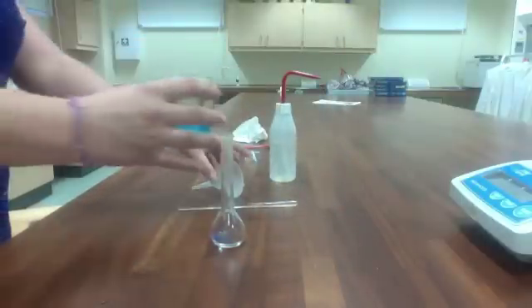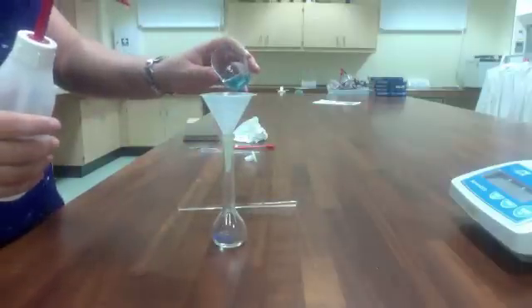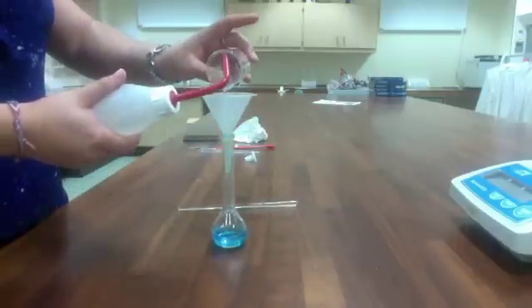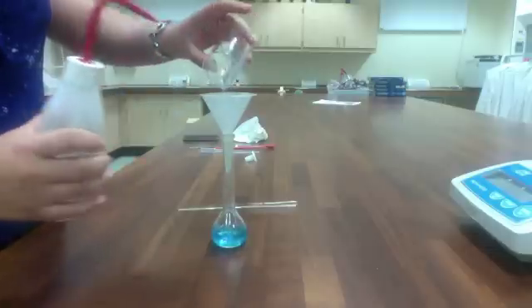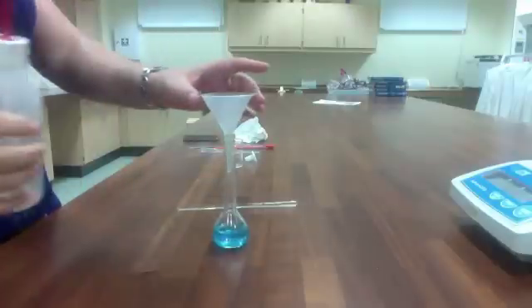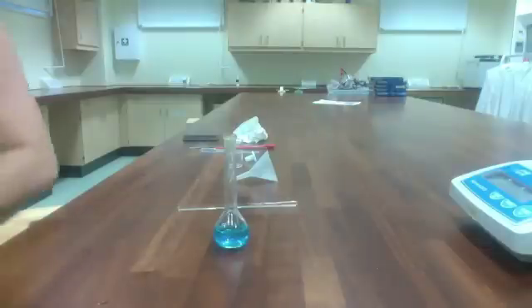Then I will transfer my solution in. You may wish to use a funnel to make it a little bit easier for the first few times. Once you've transferred it in, give your beaker a nice quick rinse into the funnel and then give the funnel one last rinse to make sure that all of the solution has been transferred.